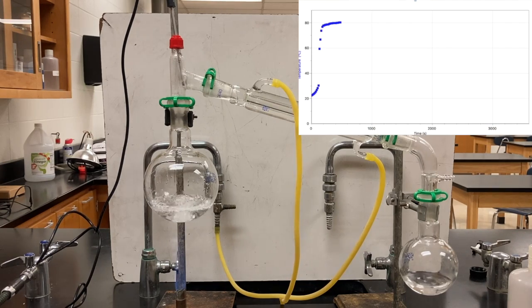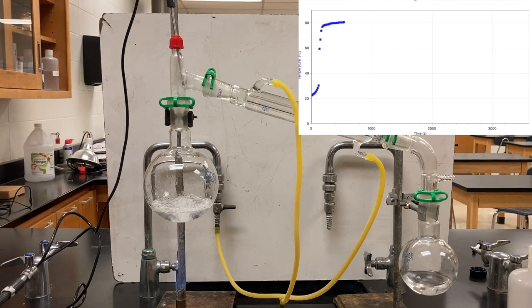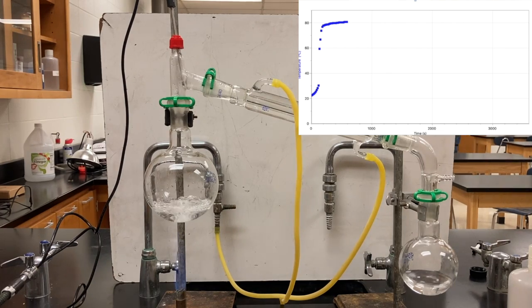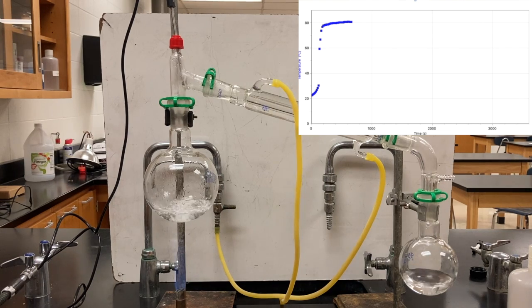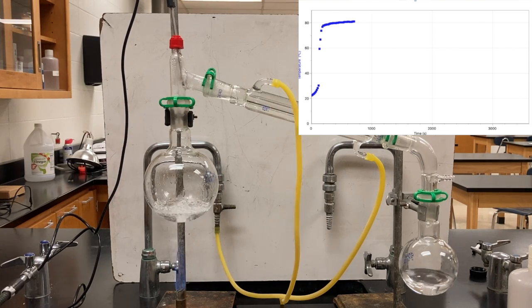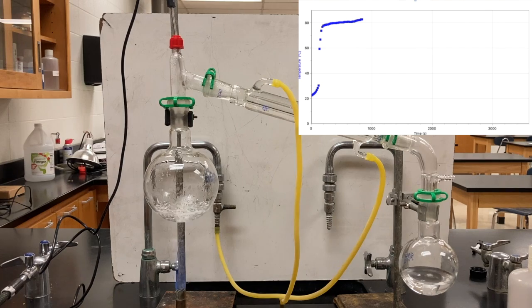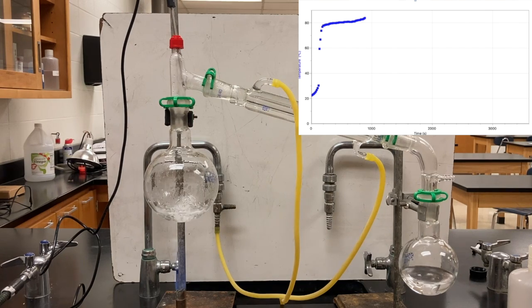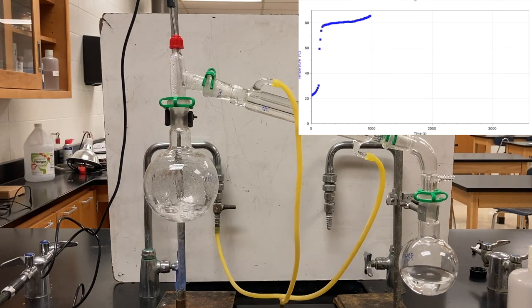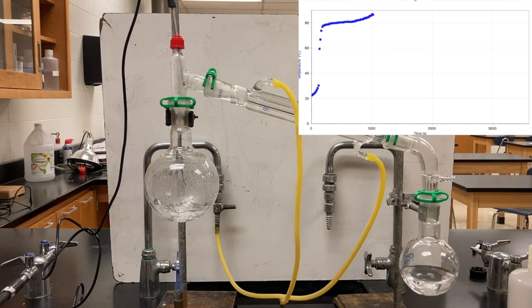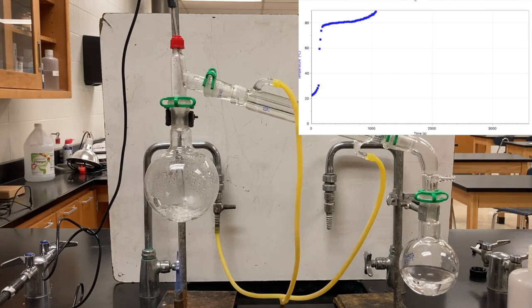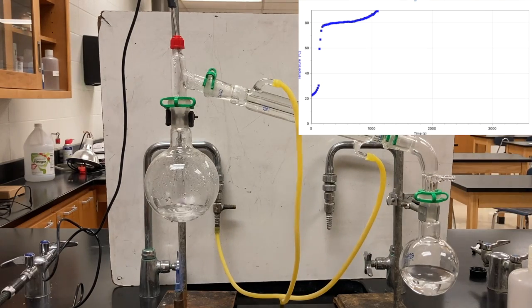So back to boiling and I've sped this way up. You can see that the level in the cold end of the apparatus is getting higher as it continues to boil. And now we don't have quite so much of a flat spot anymore. Temperature is beginning to creep up as some of the energy is now being used to increase the temperature of the water while the alcohol continues to boil.